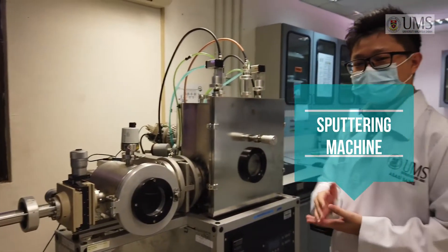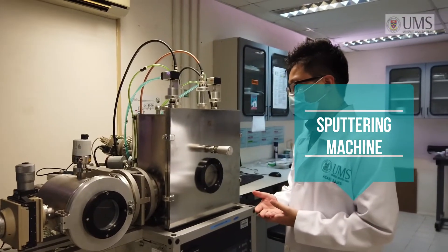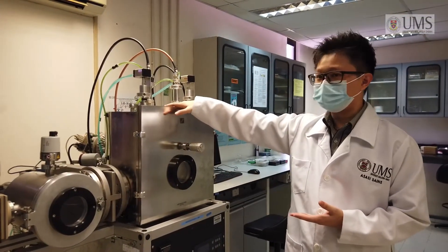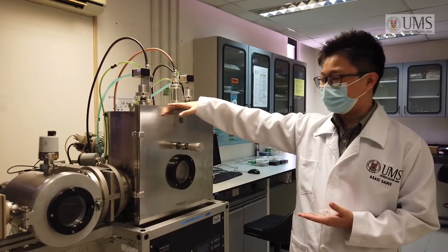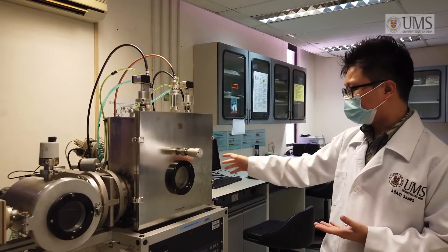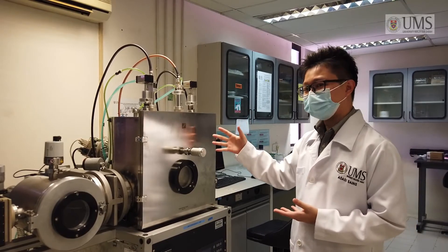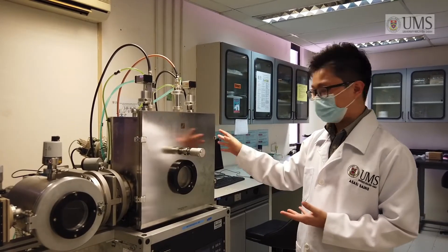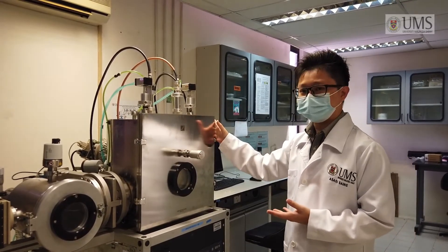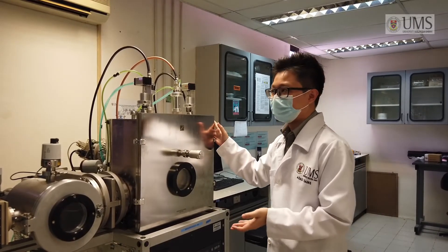The RF gun, which is known as the radio frequency gun, and we also have the direct current gun. Inside here, we have the chamber vacuum, where before the sputtering process is proceeded, all of the air will be sucked up and at the same time released to the surrounding, making sure that it's all vacuumed internally for it to be actually fabricated.